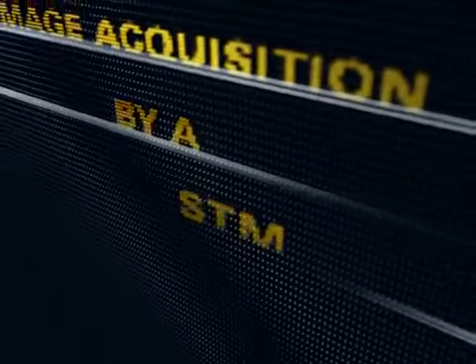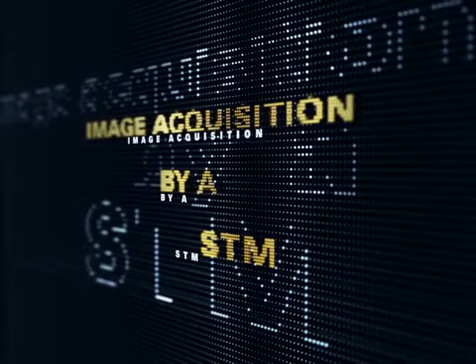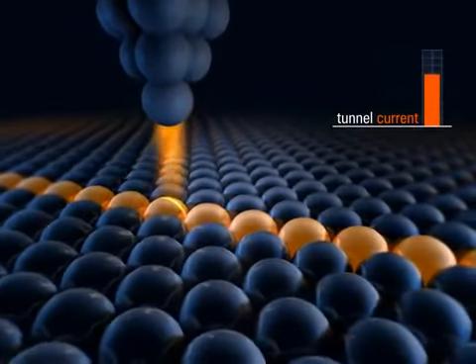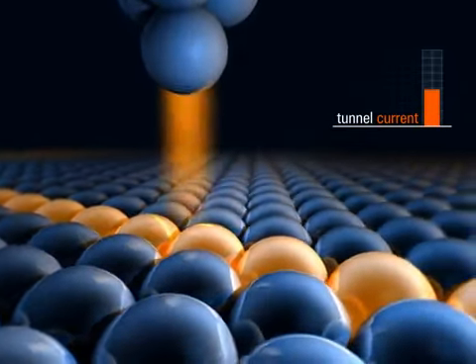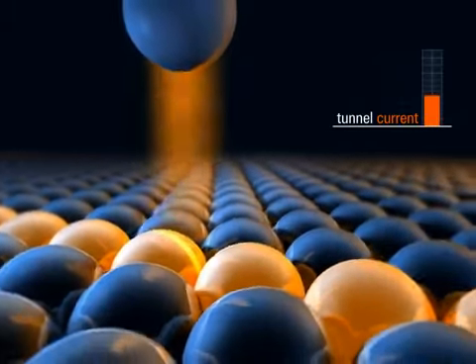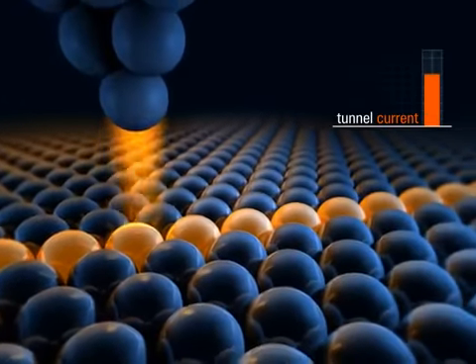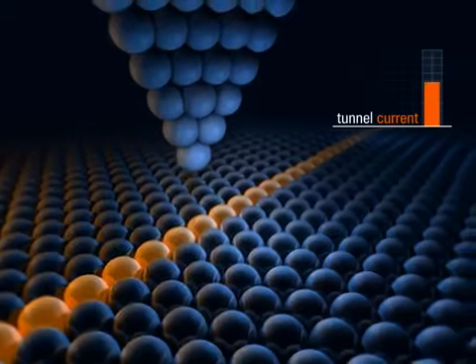Image acquisition by a STM. The scanning tunneling microscope exploits this dependence of the tunnel current on the tip sample distance to obtain height profiles of the sample. To this end, the tip is scanned line by line over the surface of the sample, and the tunnel current is measured. If the scanning tip encounters a step on the surface, the tunnel current increases due to the smaller distance between tip and sample. A sequence of line scans provides an image of the topography of the sample.